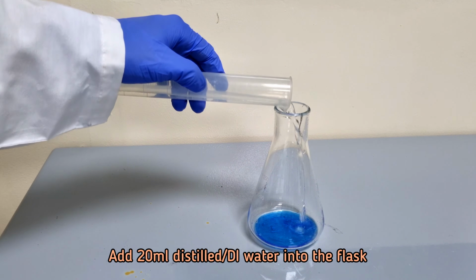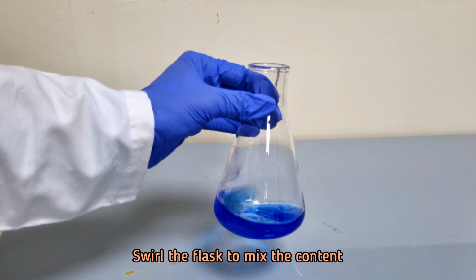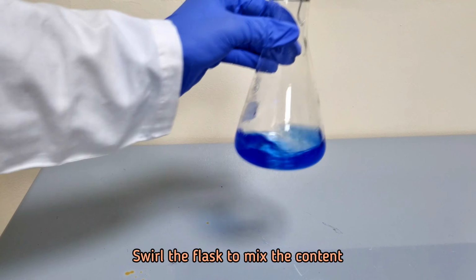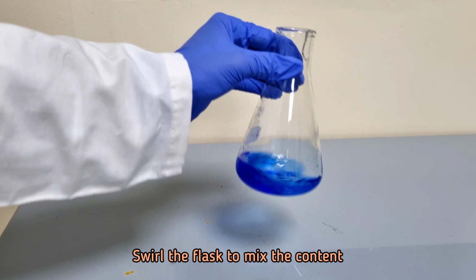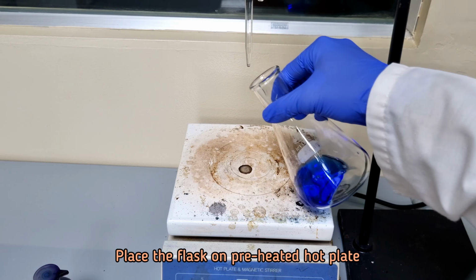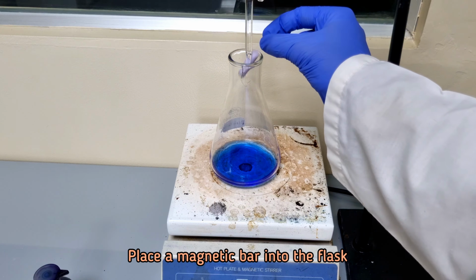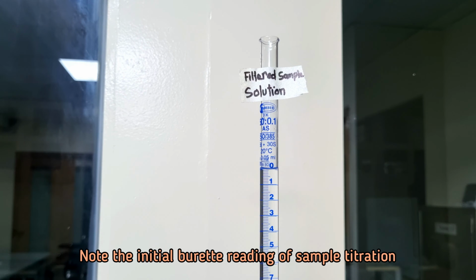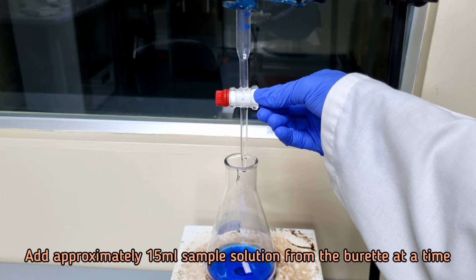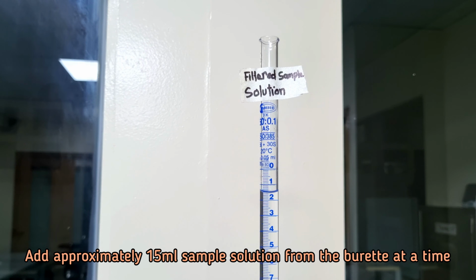Now add 20 ml distilled water and swirl the flask to mix the content. Place the flask on preheated hot plate and place a magnetic bar into the flask. Note the initial burette reading of the sample titration. Initially, add approximately 15 ml sample solution from the burette at a time.